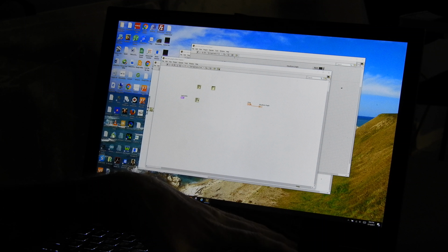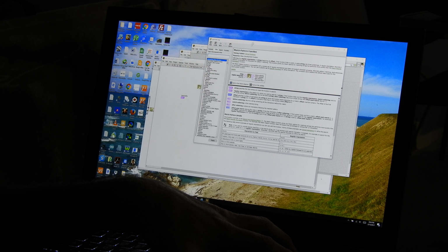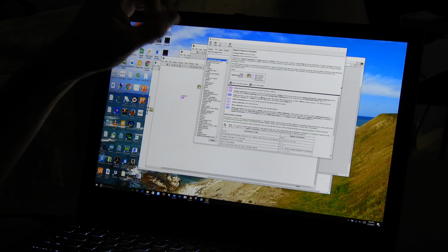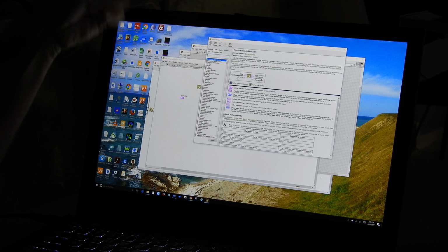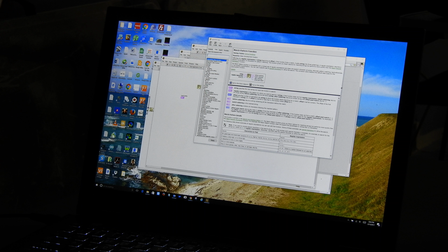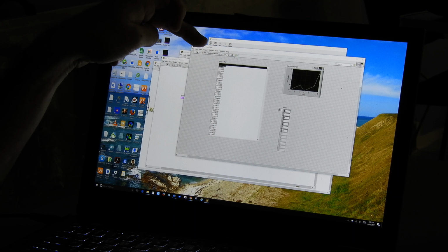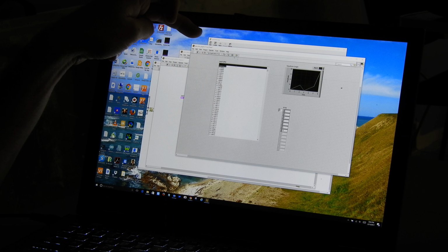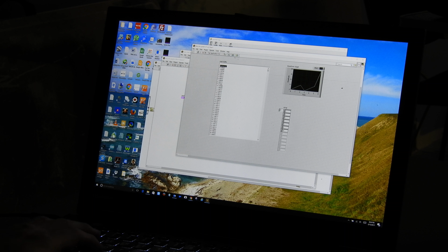There it is. All right, so I'm going to use match pattern, and when I right-click on match pattern and look at the help, what I see is it has two inputs, string and regular expression. It searches for regular expression in the string beginning at a given offset. All right? And then it's going to return before string, the match string, and after substring. What I'm attempting to do here is get rid of this extra stuff up here, and get it to start right here on this first line. So I'm going to have it search for starting up.